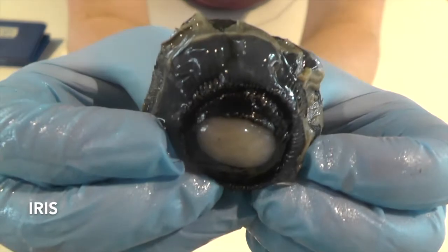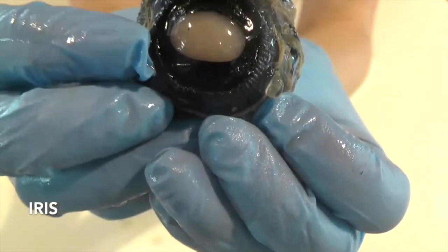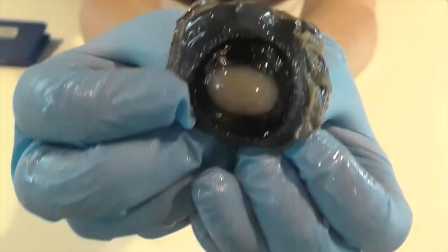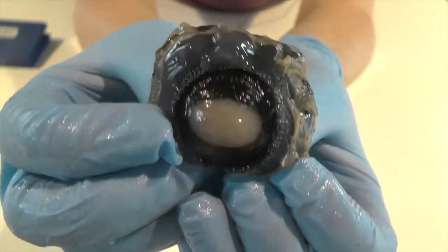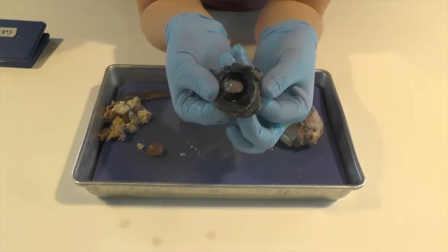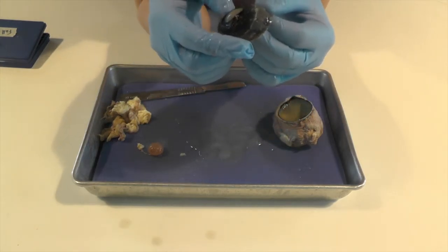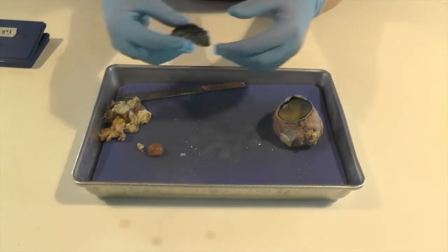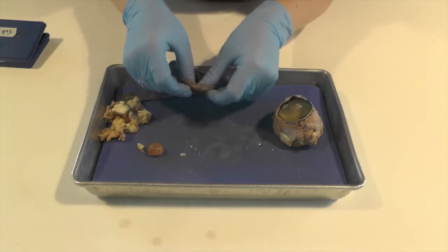And if you look closely, the iris has this really cool texture. It reminds me of a mushroom a little bit. And the iris is the color of our eyes. So cows usually have brown eyes, but I have green eyes and some people have blue eyes. So that's where you'll see the color of the eye.